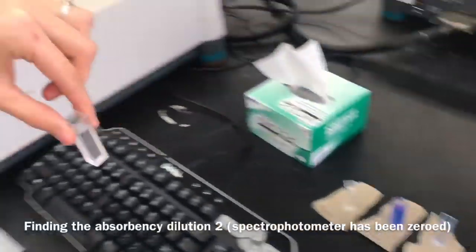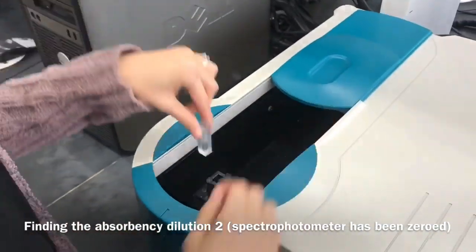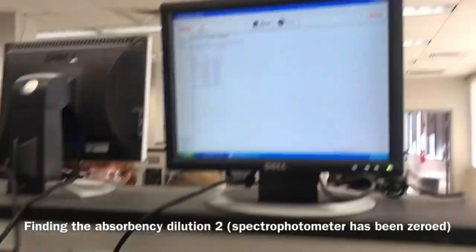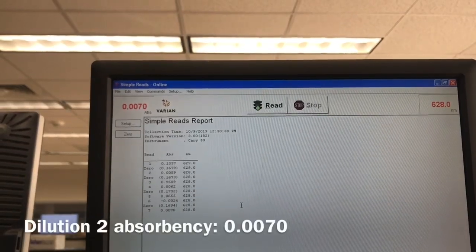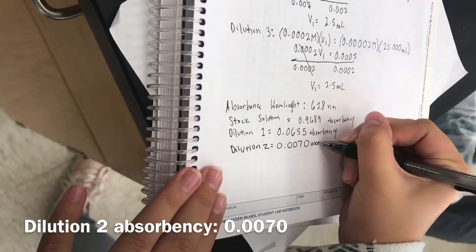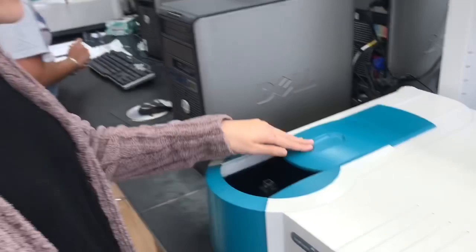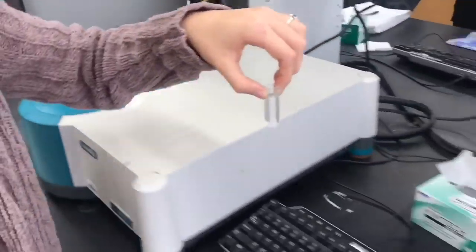Here, Jaime is properly using the spectrophotometer to find the absorbency of dilution 2. The absorbency of dilution 2 was 0.0070. Here, Jaime is carefully removing the sample from the spectrophotometer and closing the door.